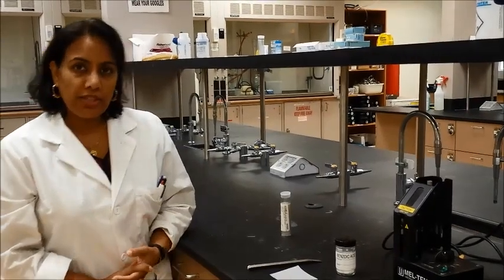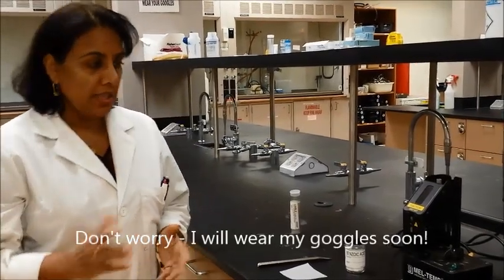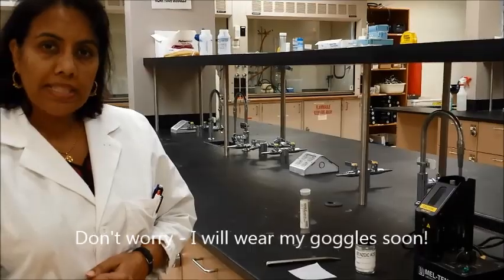I'm going to show you how to take melting points today of organic substances. There are a few things that you need as far as the equipment is concerned.